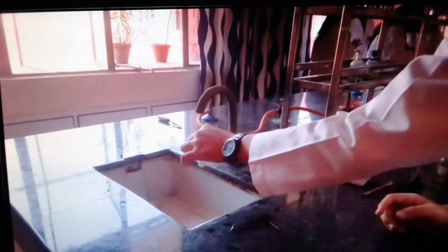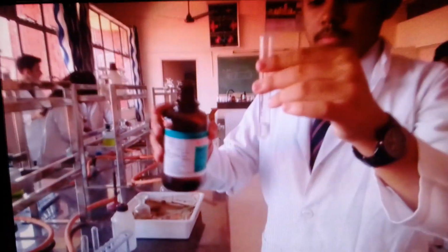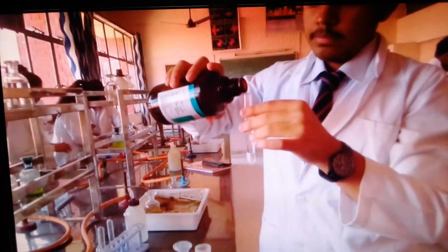Now to confirm further, you need to dissolve this PPT in ammonium hydroxide. Since our aim is to dissolve the PPT, there is no point in taking this lot of PPT, discard half of it. Fine. With the leftover PPT, add ammonium hydroxide in excess and observe the dissolution of the silver chloride. That's it. It's becoming clearer. You can add a little more if you want. Excess of ammonium hydroxide should make your test tube contents clear, and they are, which shows that the confirmatory test for chloride is positive.